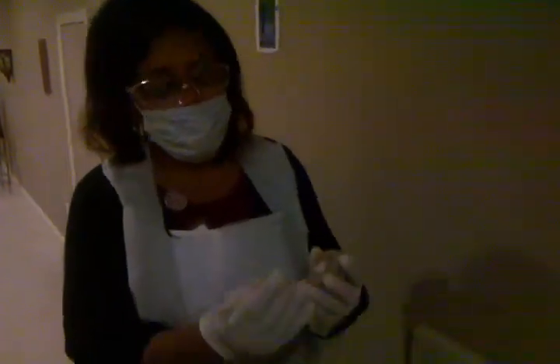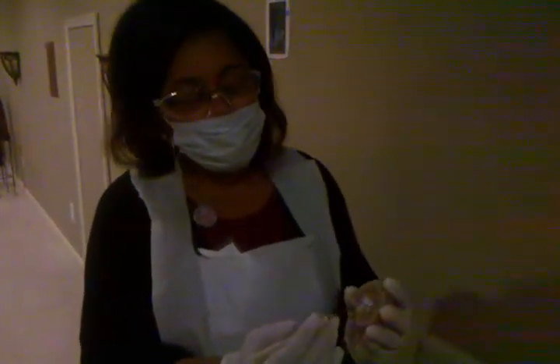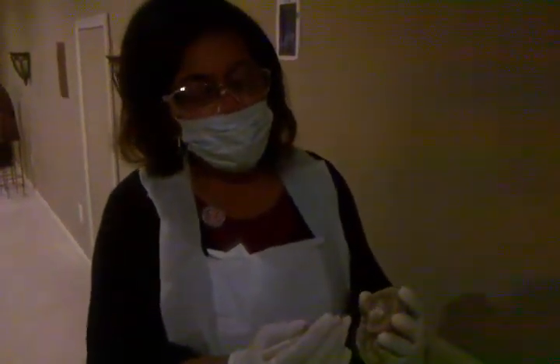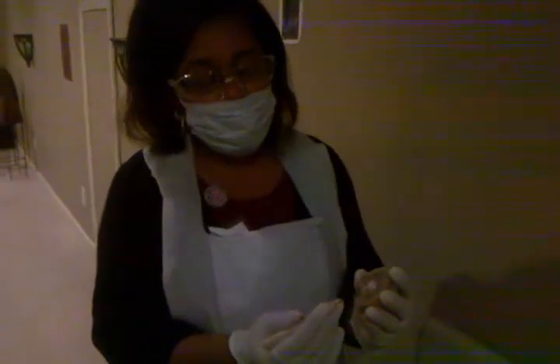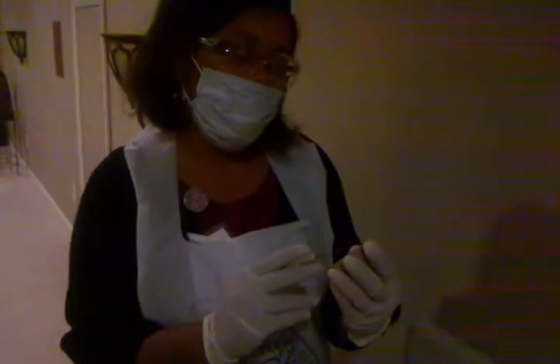The minor calyces are where the urine starts collecting to drain. I'm trying to see, and I'm assuming that's going to be just beyond the renal papillae. And we usually have about 8 to 10 of those.